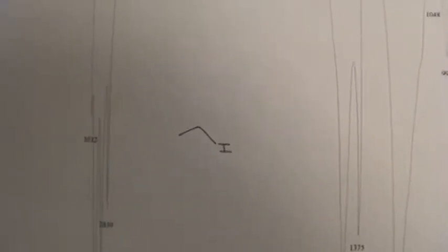So this is the phenacetin experiment. We'll try and get through this quick. When you look up in Pavia under RX, alkyl halide groups, whether it's chlorine, fluorine, bromine, or iodine, they only list 2 peaks in their table.